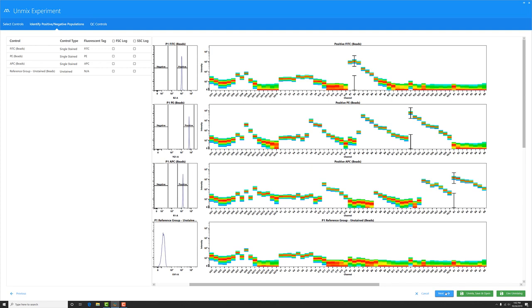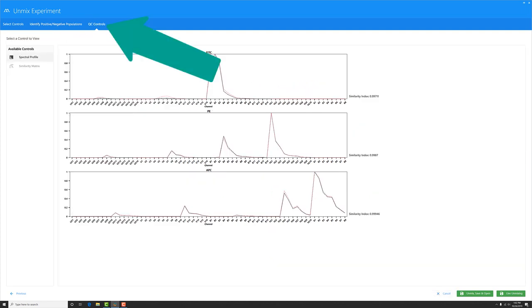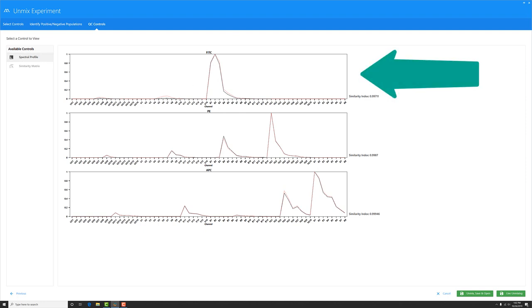I'm going to click Next to go to the new area we've introduced called QC Controls. First, in the Spectral Profile tab, the software will overlay the dye that you ran today with a benchmark dye that the administrator has stored in the system. So if I look here at this FITC control, I can see that the two dyes overlay pretty well. In addition to getting a visual, we also present something called a similarity index. It's on a scale from 0 to 1, and the closer you are to 1, the better the match with the dye you're comparing against.